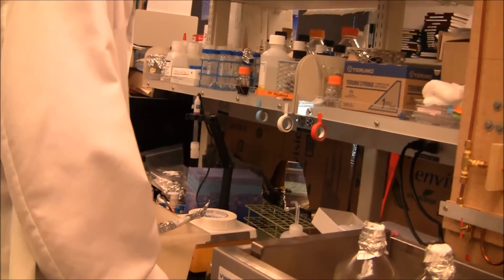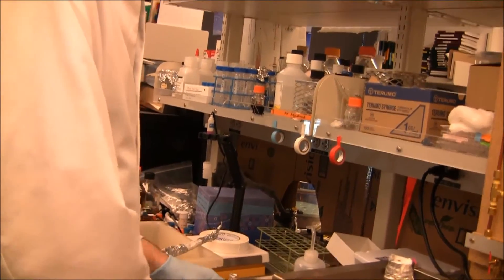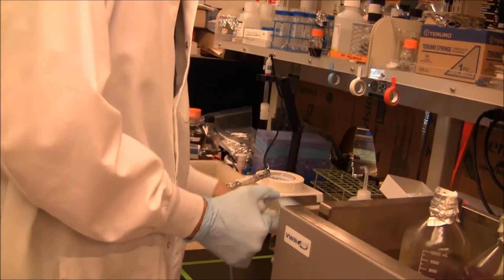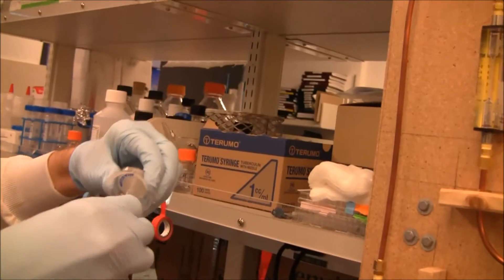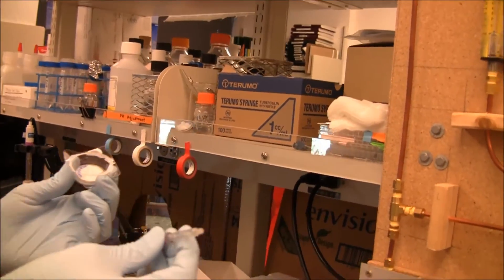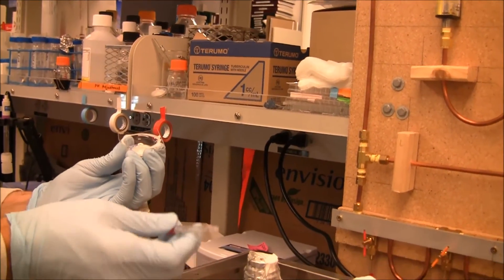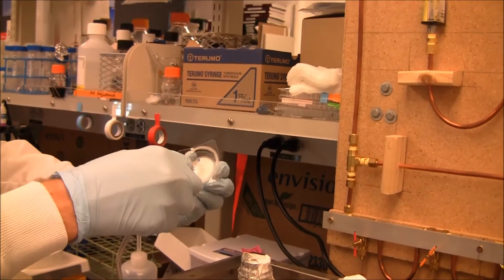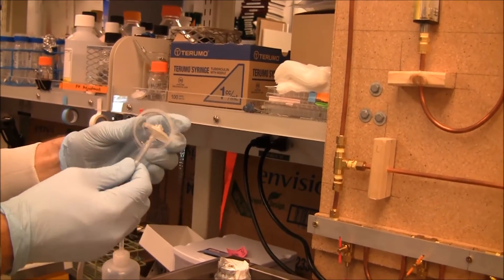So if you can show how those filters sit on the end of the line. Sure. So, at the end of the line, we just made a, we just used these tuberculin syringes as the end. And they work quite well, cheap, easy, quick. And most filters will just sit on the end of it like that, it's pretty simple.